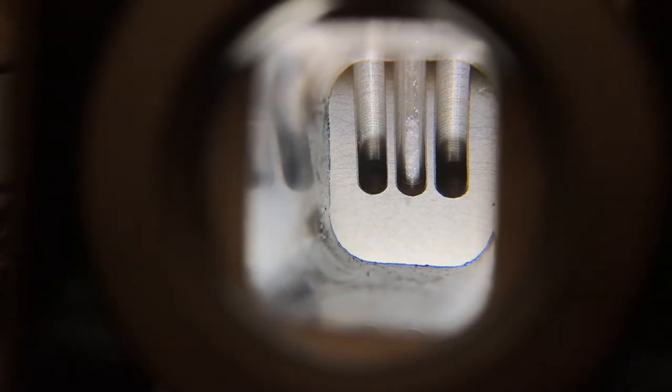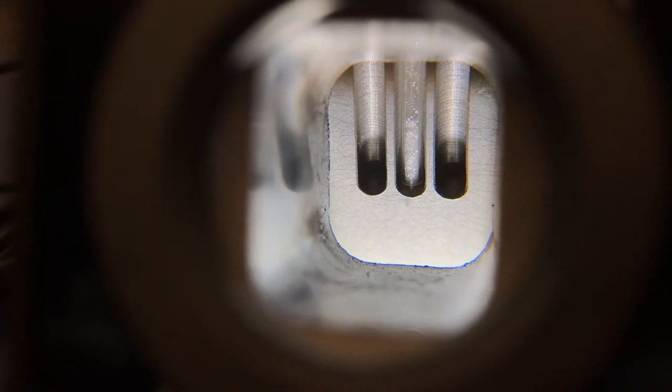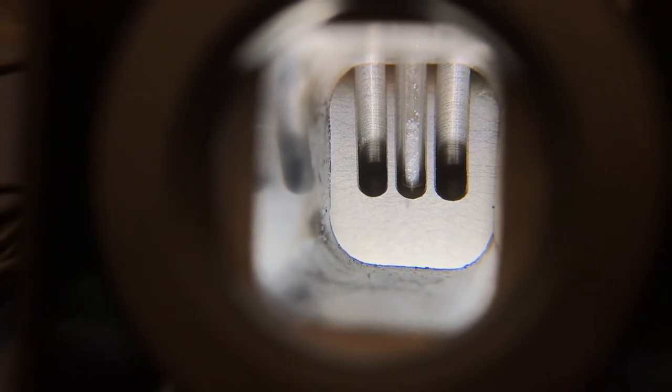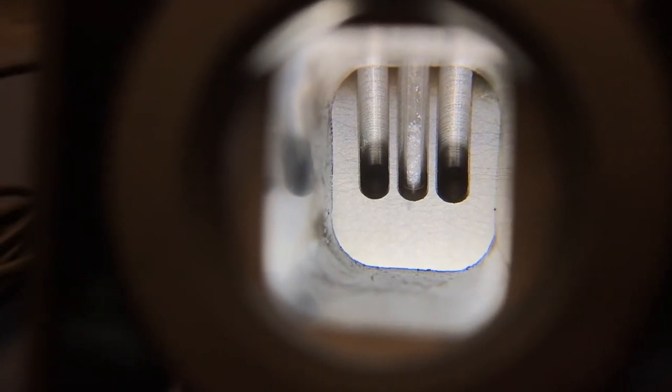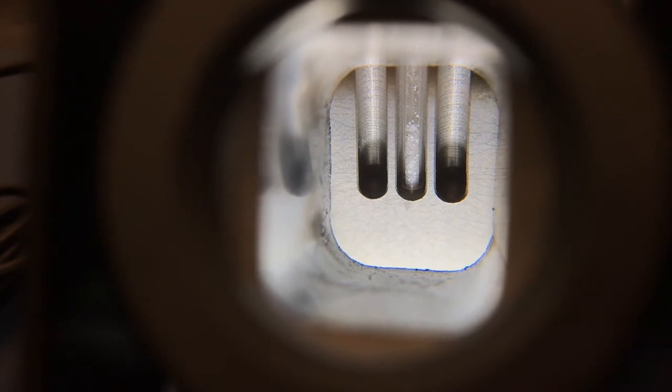Watch the solid through the magnifying glass carefully. Record the temperature when the first droplet forms and the temperature when there is only liquid in the capillary tube.